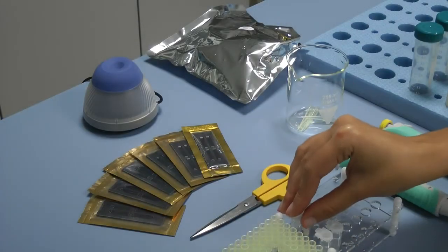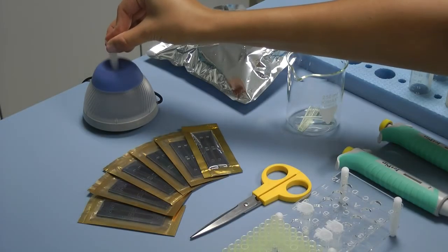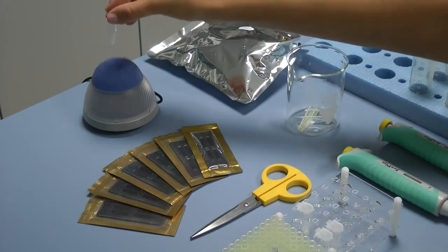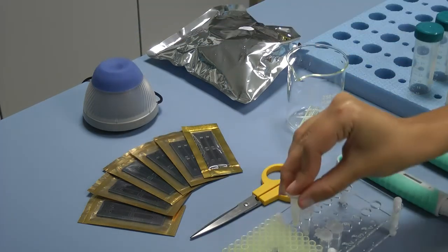One minute is needed for an interaction of the solution with the dye. If it's less than a minute or more than 20 minutes, the results may not be accurate.